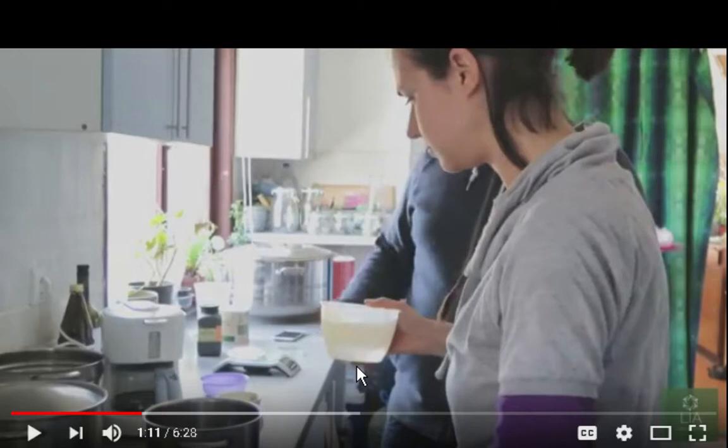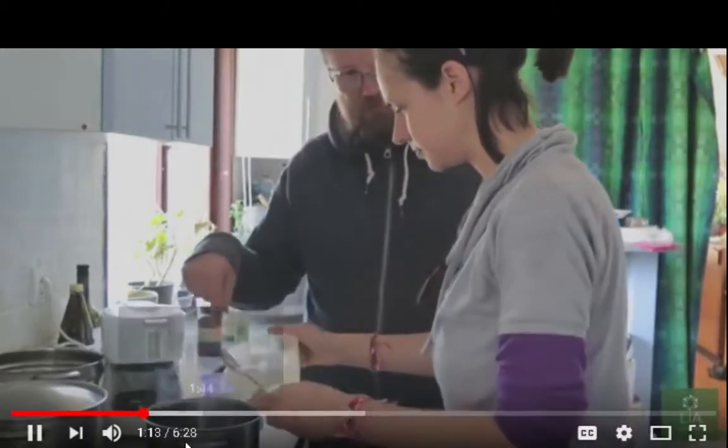I noticed there were two setups. In one, people would boil the distilled water, and the other would be, once they have their solution cooked, to take that solution and put it in the pressure cooker, in a container, and sterilize it that way, which I'm not familiar with exactly how that works. I just know that they set the pressure to like 15 psi for maybe 20 to 25 minutes, and that sterilizes the solution. Let's see what they do here.